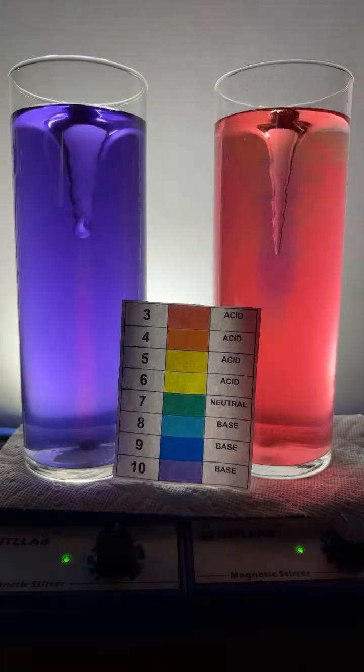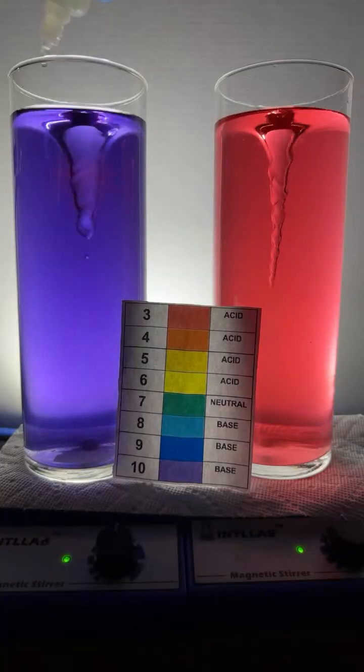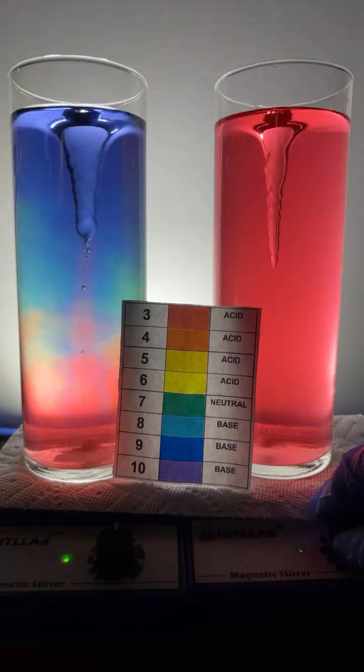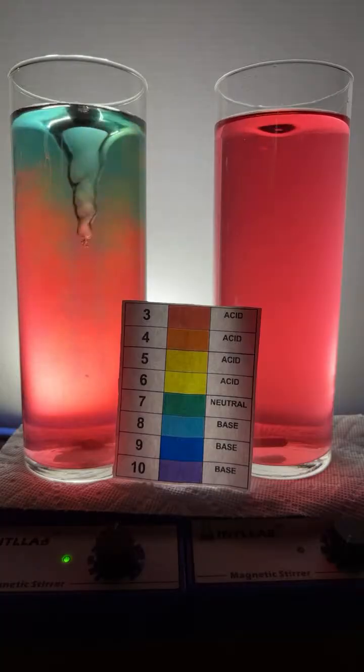Let's try to get the static rainbow over here on this side. So let me just do a couple drops of acid over here on the left first, trying to get some color shifts over there. Sure enough. And then we're going to turn this one off here. So I've turned this one off. Oh, look at that gorgeous rainbow over here. We got some nice rainbow action.